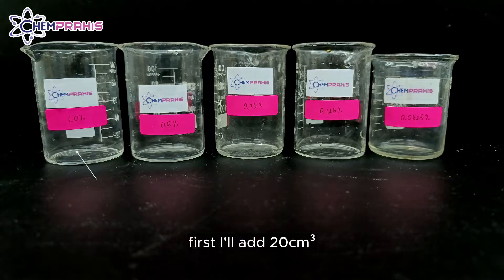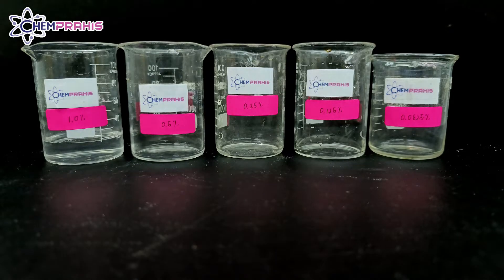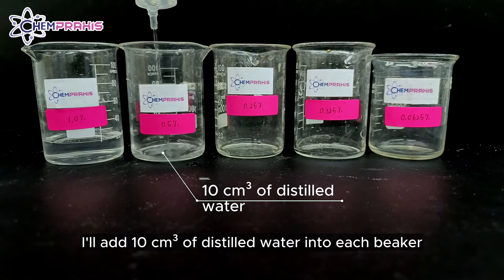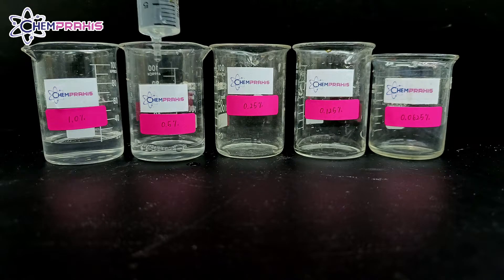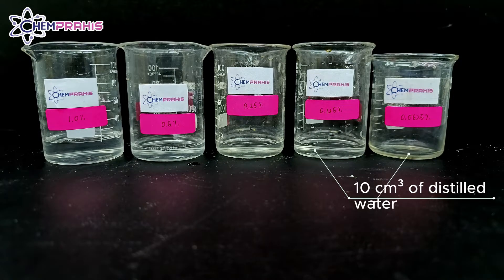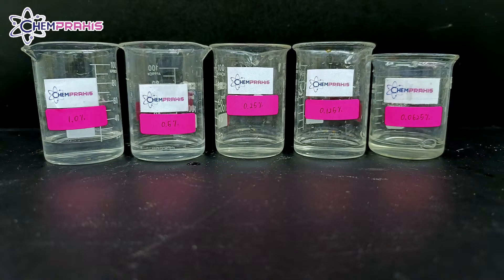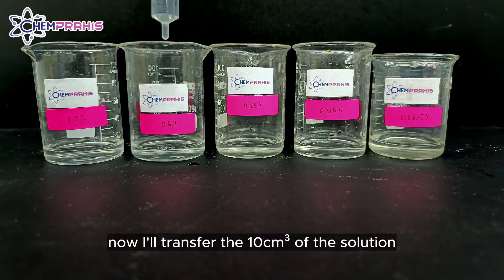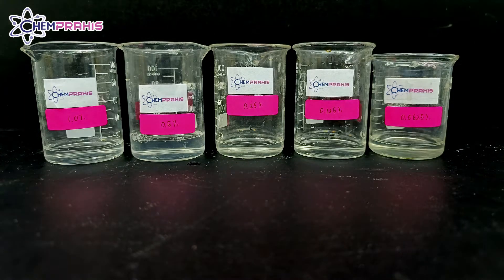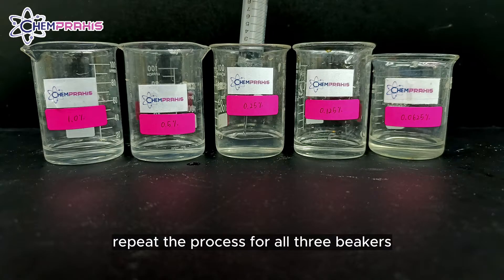First, I'll add 20 cm³ of reducing sugar solution to the first beaker. Before transferring the solution, I'll add 10 cm³ of distilled water into each beaker. Now I'll transfer 10 cm³ of the solution from the first beaker to the second beaker. Repeat the process for all 3 beakers.